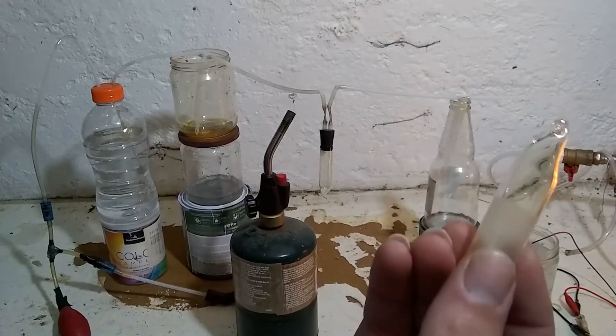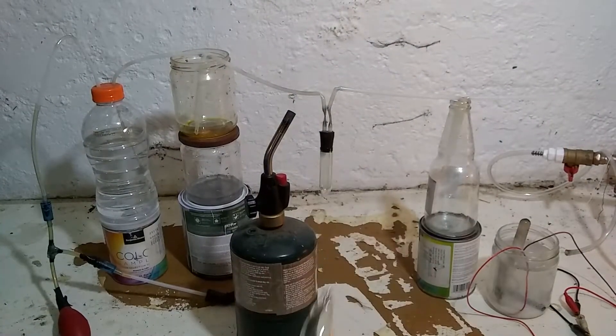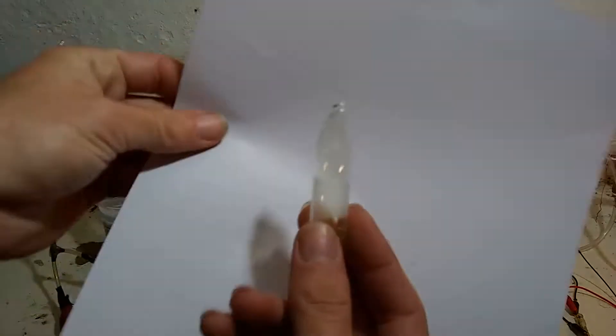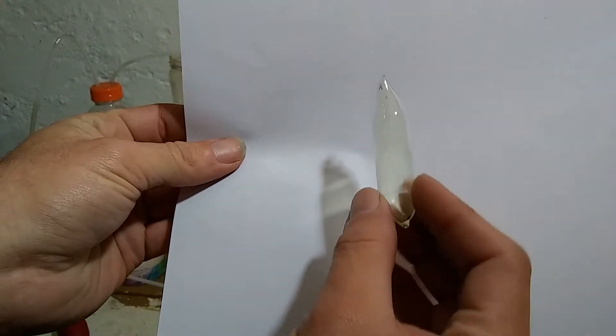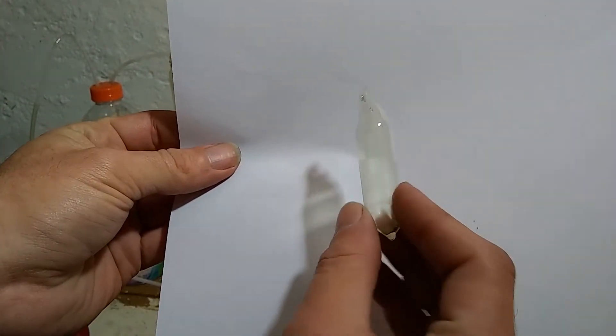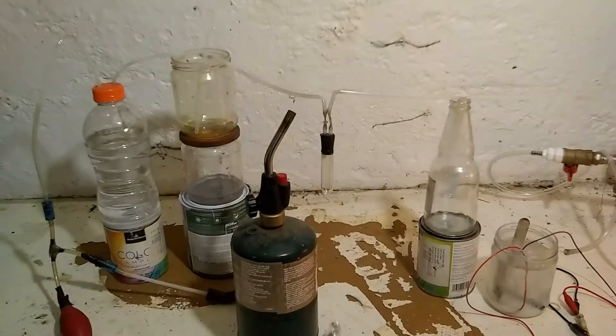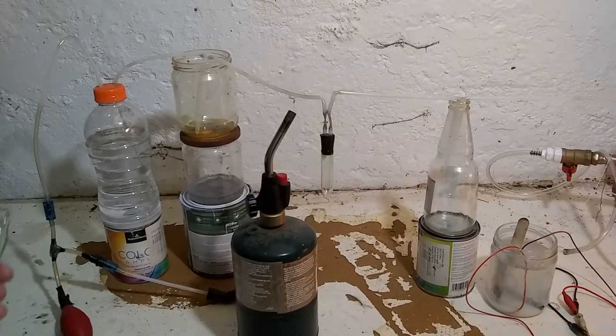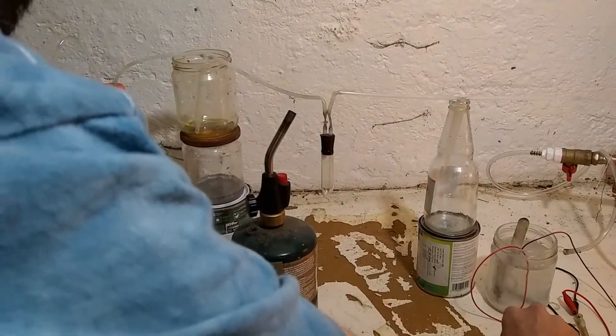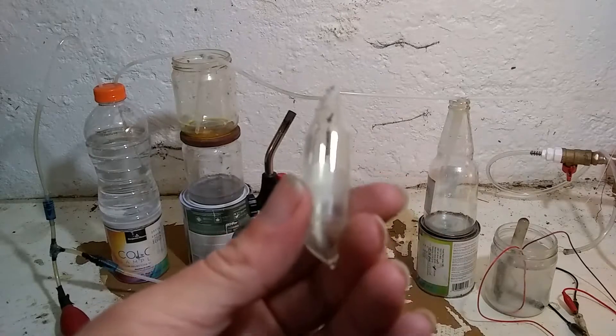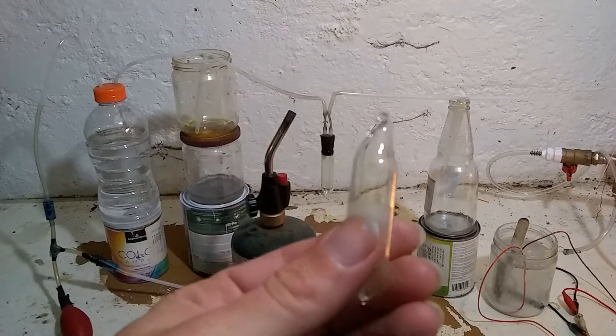Well, that's that. Yeah, there's water in it, but you see there is the pale yellow of chlorine in there. So it's done. Disconnect the power. Let this cool off and hang it in the table.